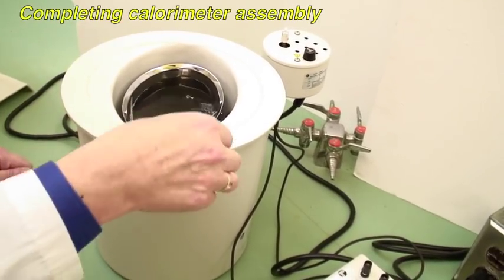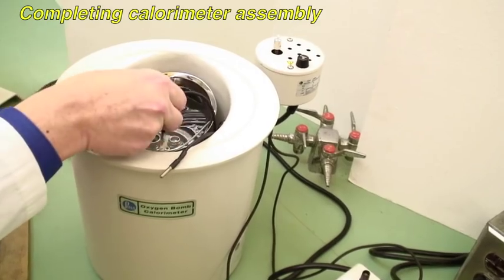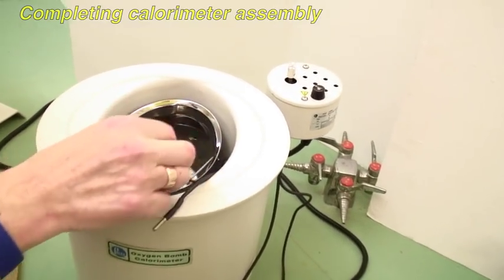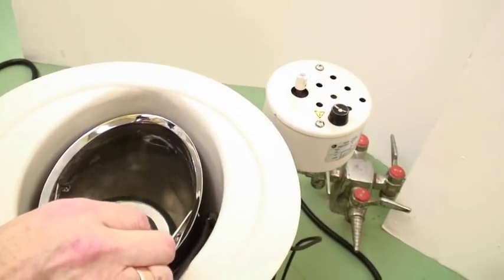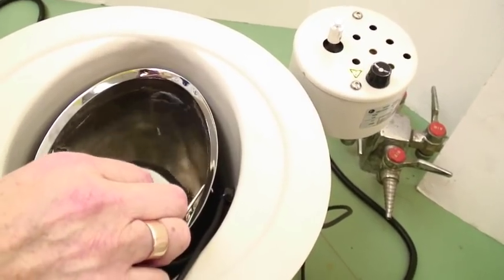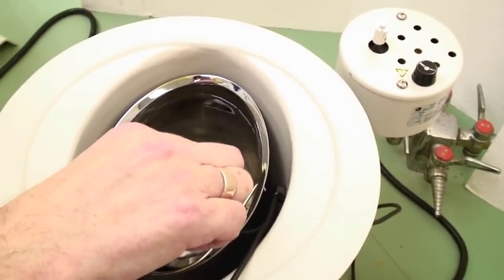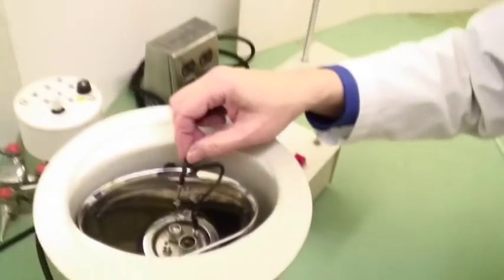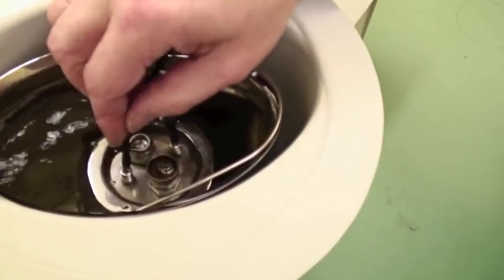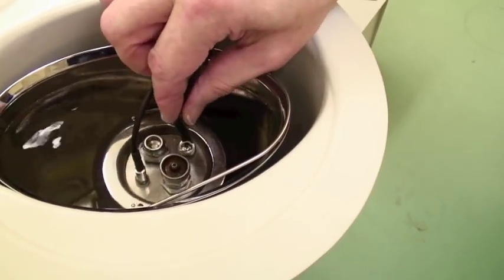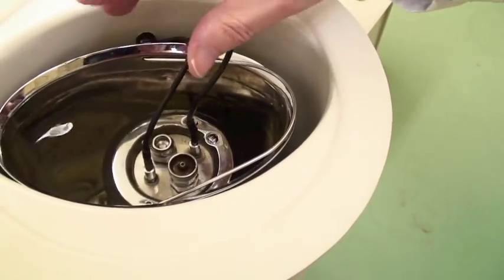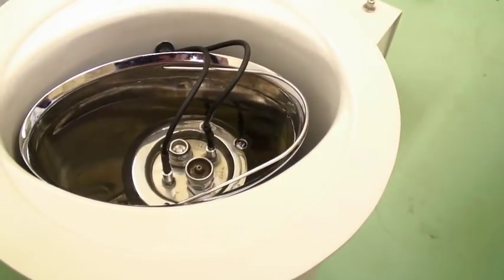Now while you're still there, these are the electrodes for firing. They go into those two electrode depressions. Try not to get your fingers wet at this point. Hold the wire and push down if you can. And take the second one and push it in. If your fingers do perchance get wet, shake them back in. We're now ready to put the lid on.